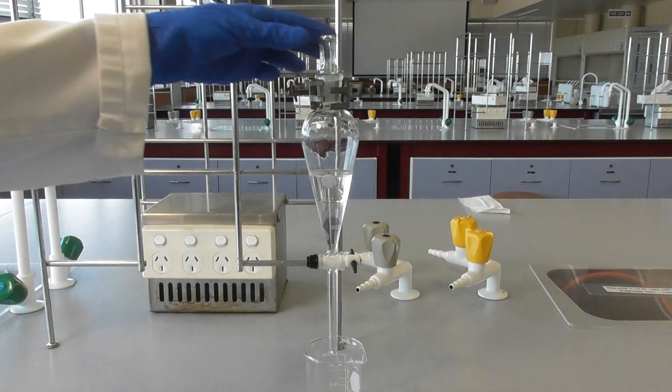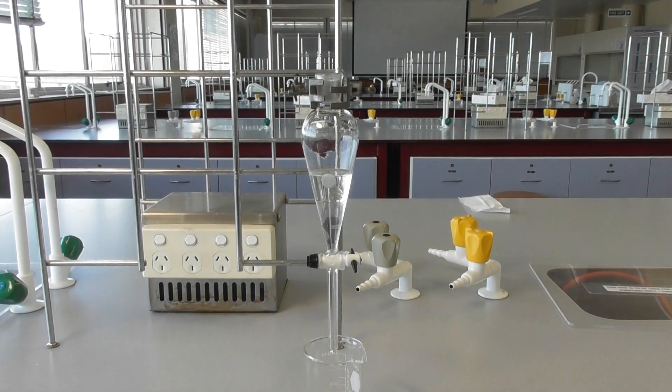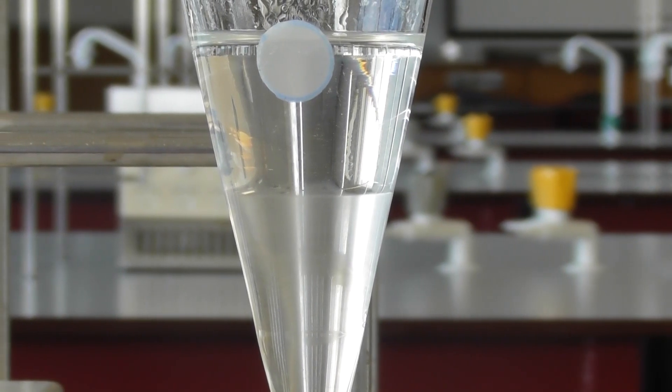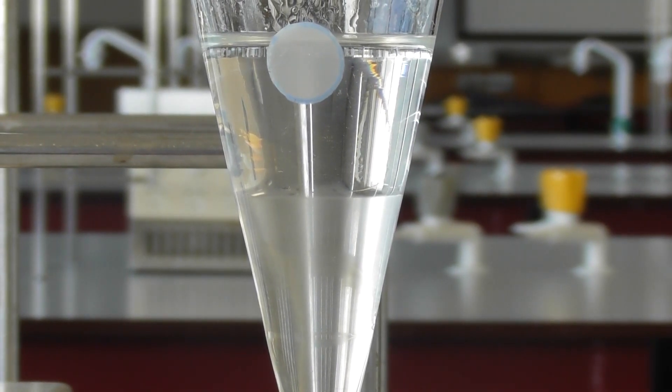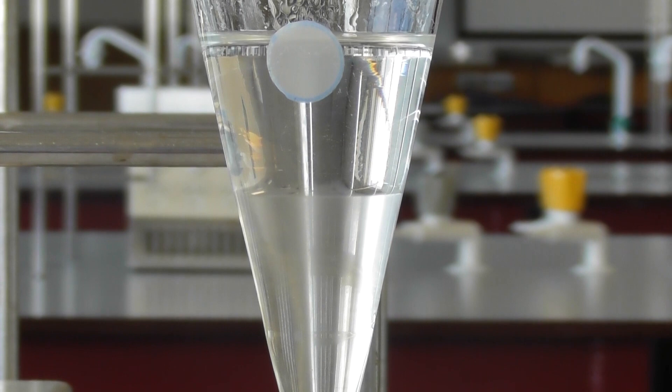When no more gas is formed, clamp your funnel and remove the stopper. Look for the phase separation. You should be able to see two distinct layers.